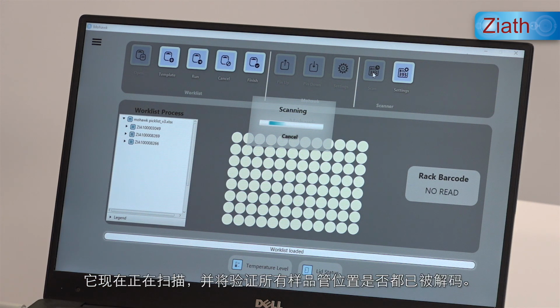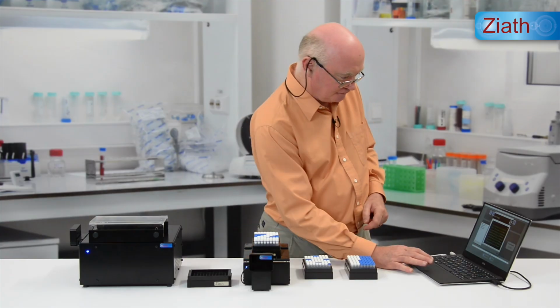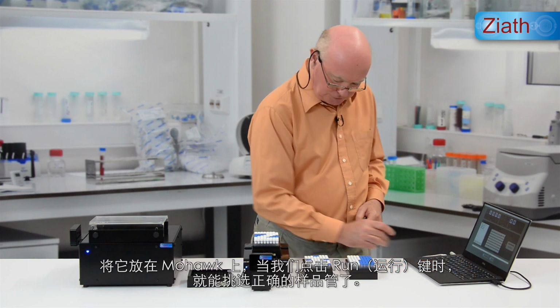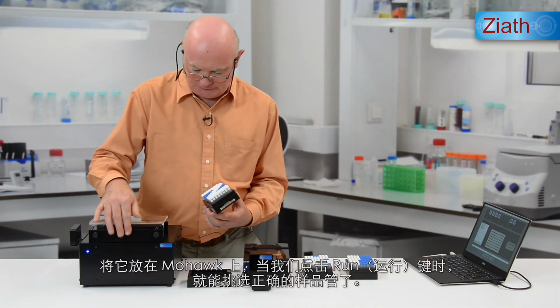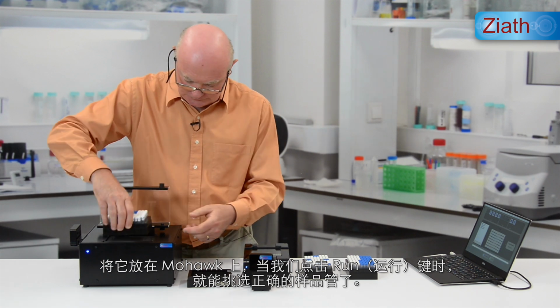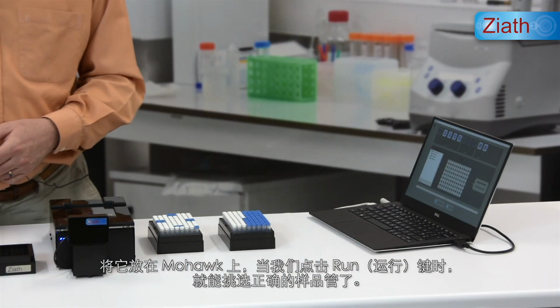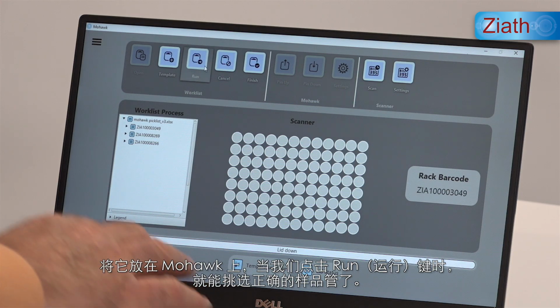It's now scanning, and will verify all of the tube positions have been decoded. If we then place it onto the Mohawk, the correct tubes are now picked when we hit the run key here.